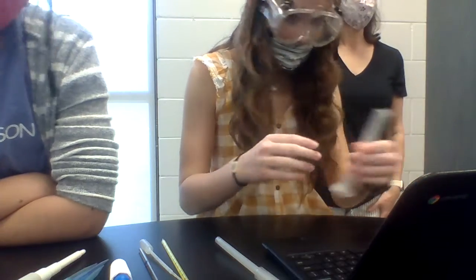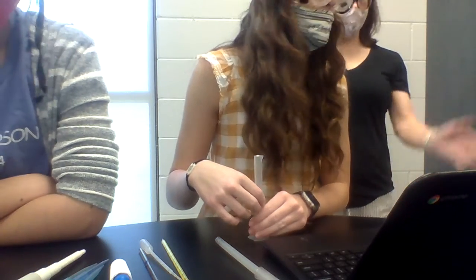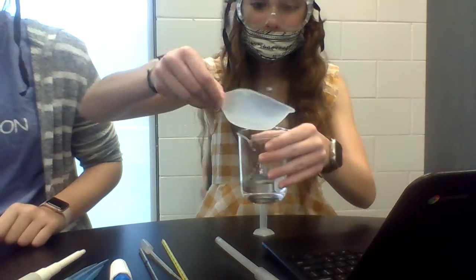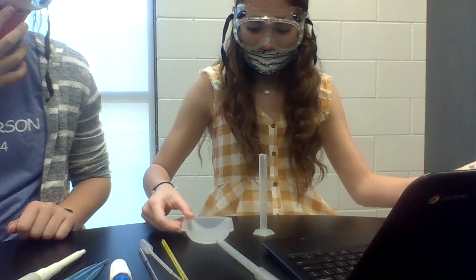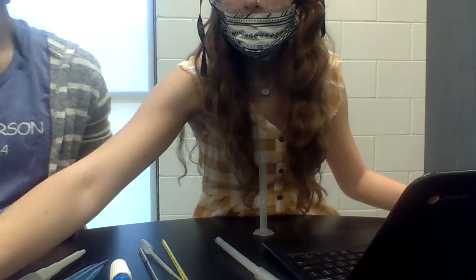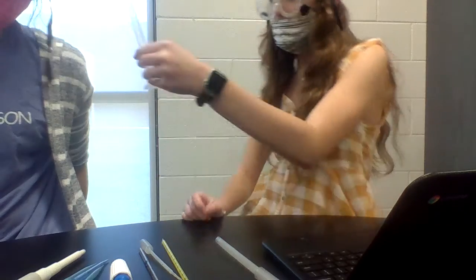Now once we're done with the beaker, we take the water out of the graduate cylinder. You can dump it back into this and we'll reuse it for the next one. Okay, so y'all are going to be good. Oh gosh, I'm just staring at the camera. It's kind of awkward. Do we use one of these things? Yes, you use this now.